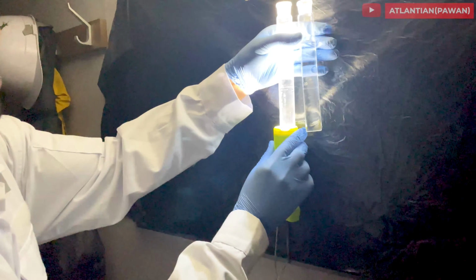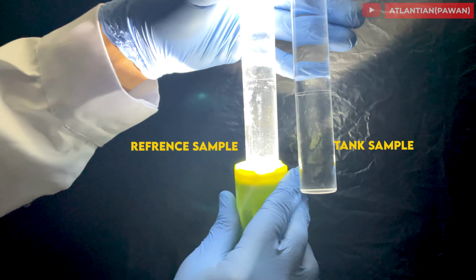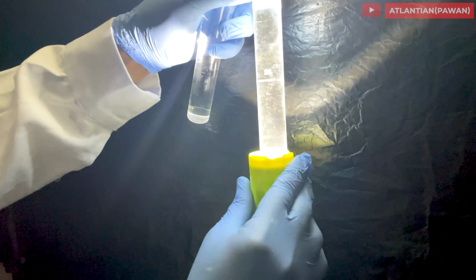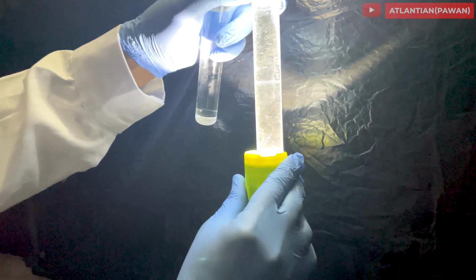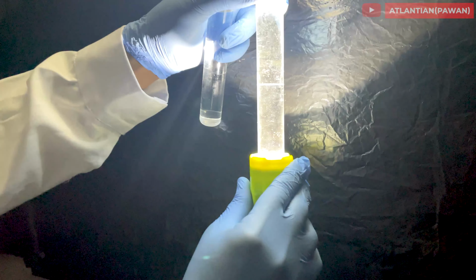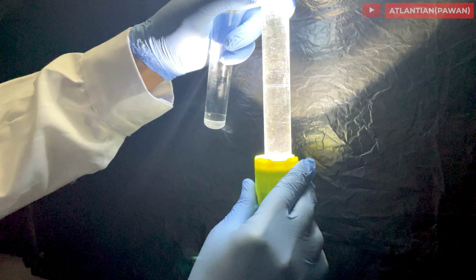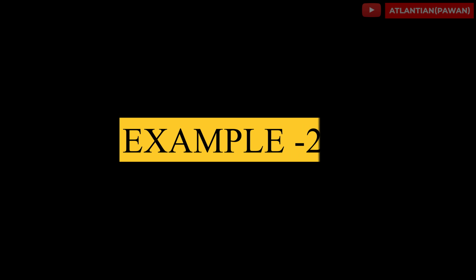So this is my reference sample. As you can see, it's crystal clear. There is no turbidity or haziness in the reference sample. And this is my tank sample, which is also clear. So presently my tank was clean, hence you can see the hydrocarbon in the tank was nil, or it was as clear as the reference sample. But let me show you another example where my tank was not clean and where we can clearly see the presence of hydrocarbon.